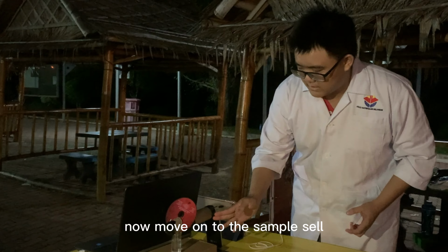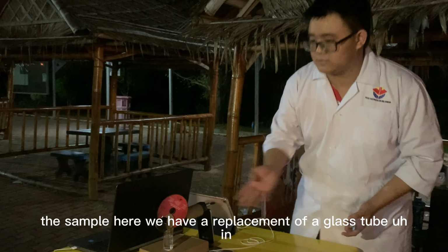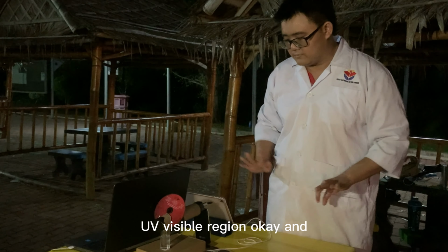Okay, now we move on to the sample cell, whose function is essentially to hold the sample. Here we have a glass tube as a replacement. In an actual UV spectrophotometer, it's made of fused silica, which is transparent throughout the whole UV-visible region.